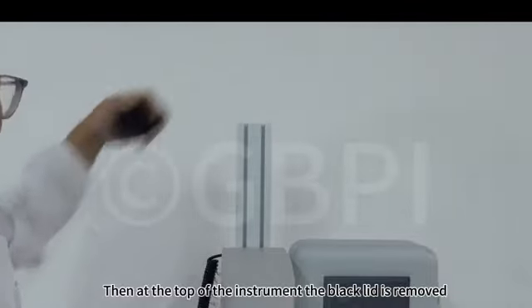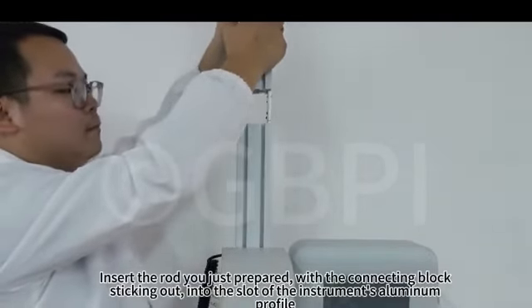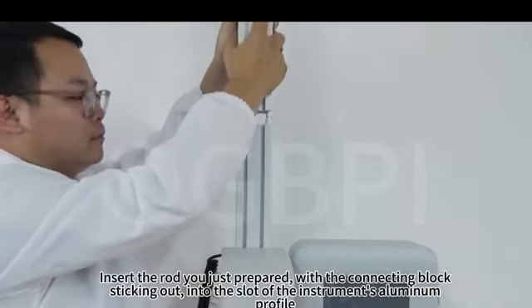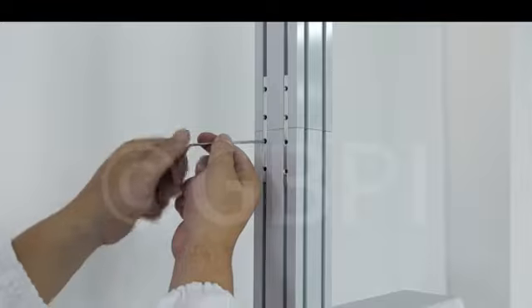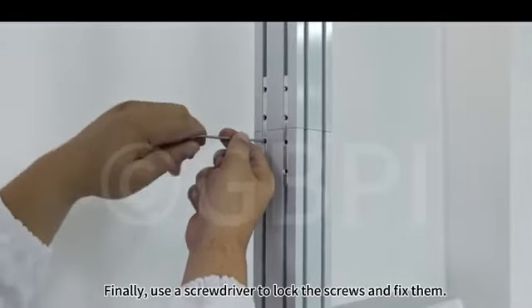Then at the top of the instrument the black lid is removed. Insert the rod you just prepared, with the connecting block sticking out, into the slot of the instrument's aluminum profile. Finally, use a screwdriver to lock the screws and fix them.